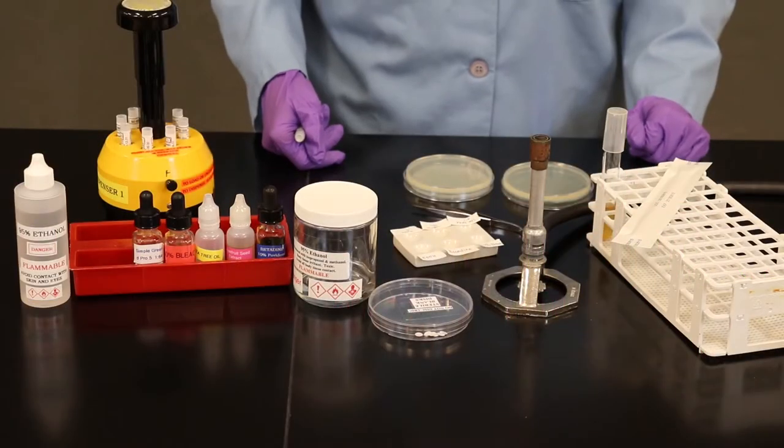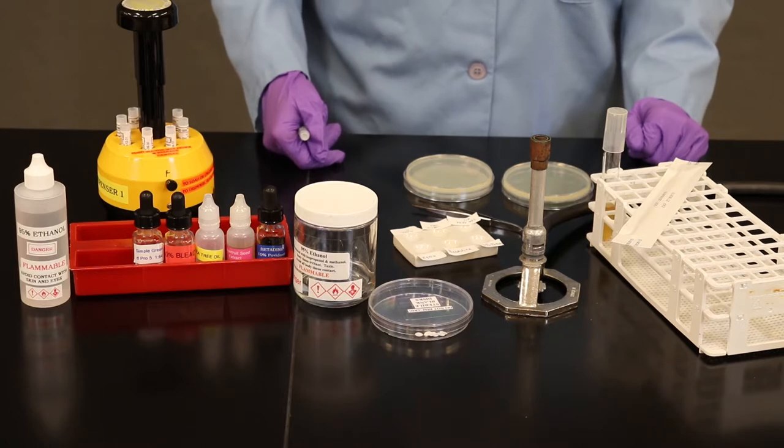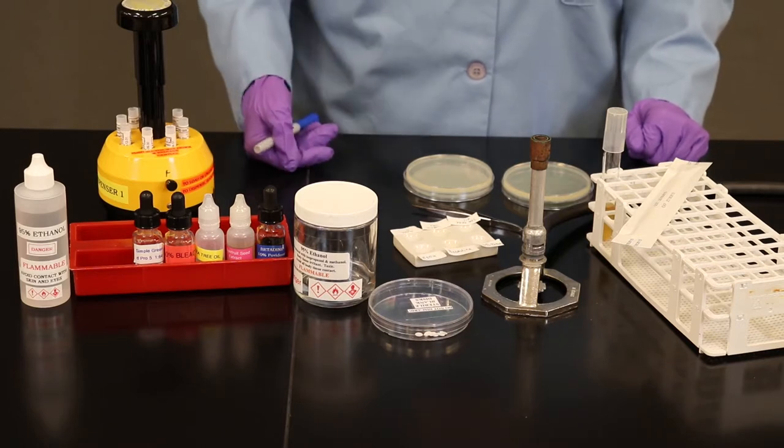Welcome to Bio 205 Microbiology at Pima Community College. In this video, I'm going to walk you through how to test the effectiveness of chemical agents using the Kirby-Bauer method.